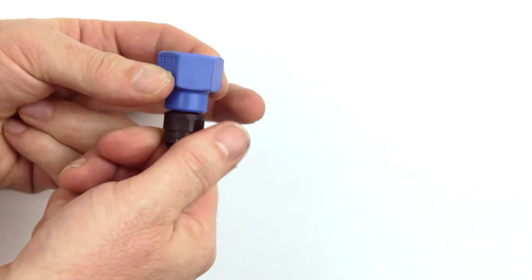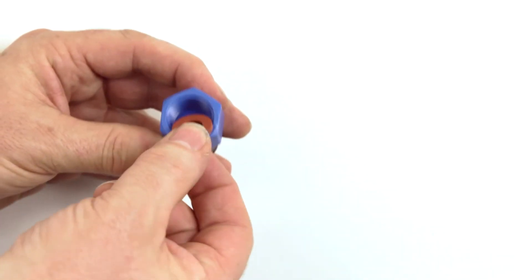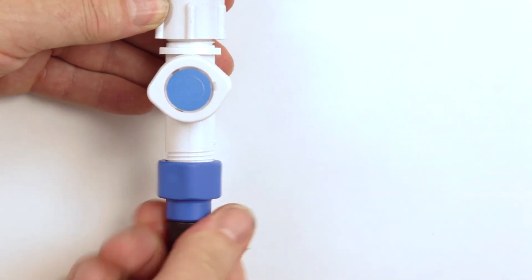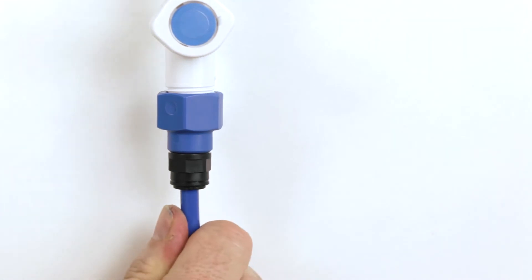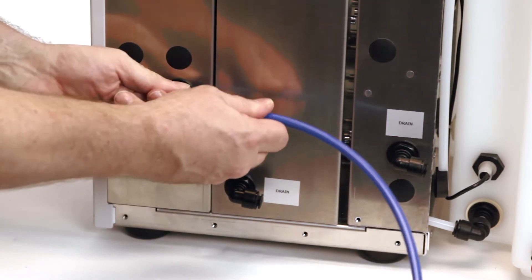Connect the suitable 8mm adapter to your water supply. Cut the 8mm blue tube to the required length and join your water supply to the water in connection.